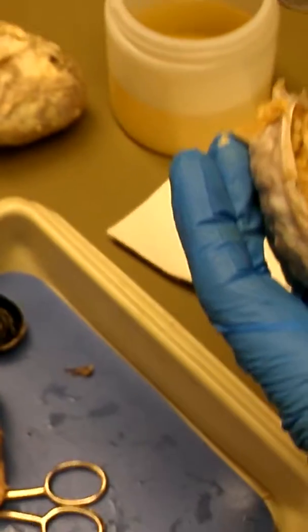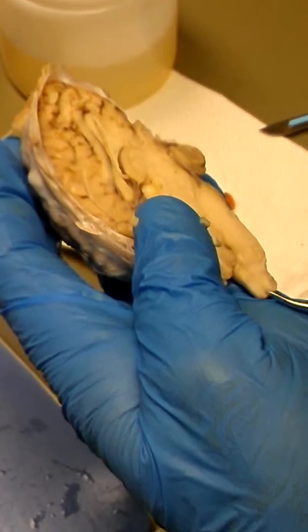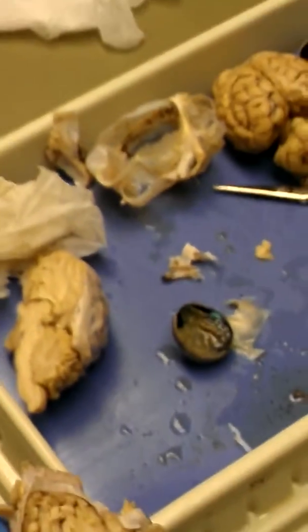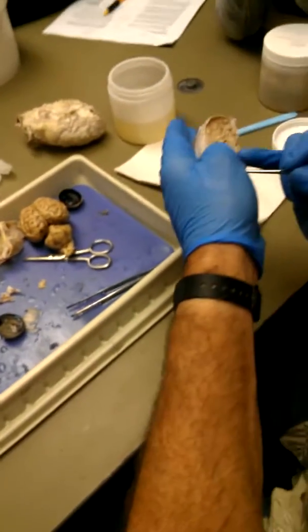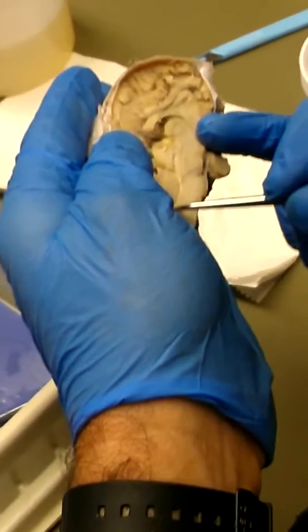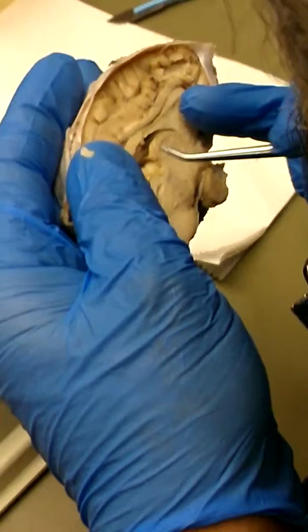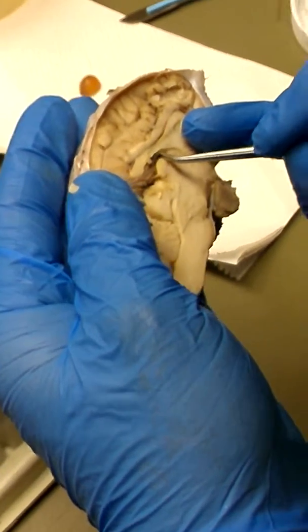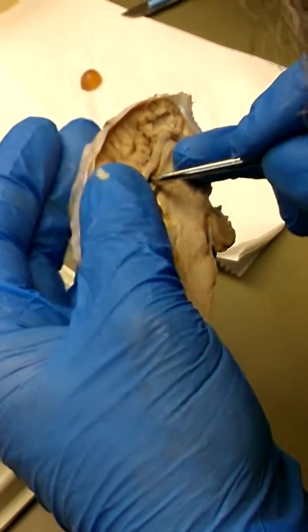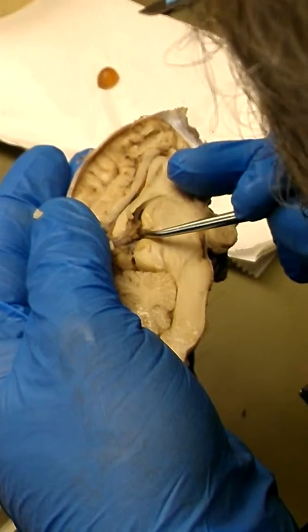And then very, very slightly, I can see how the cavity comes in and becomes this little tiny trace that's right here. That's connecting to the central canal of the spinal cord, dorsal hollow nerve cord. And this is the third and fourth ventricles. This is the fourth ventricle under here, comes up here, becomes the third ventricle. And now right here, there's a little trace that comes up and connects up through here, and it comes up into there. So now this is a great dissection.